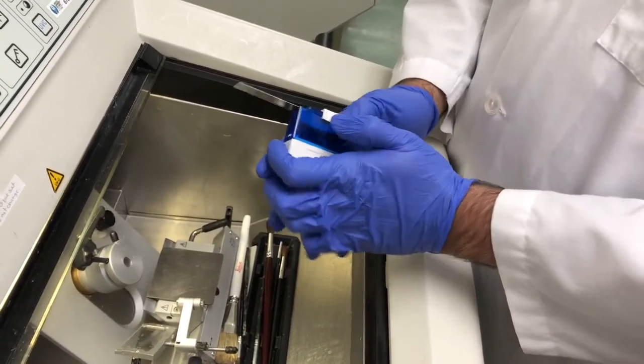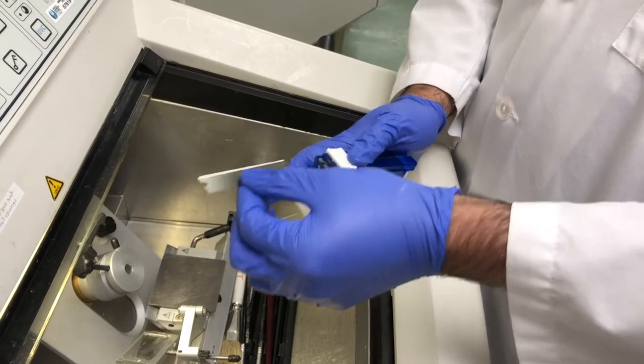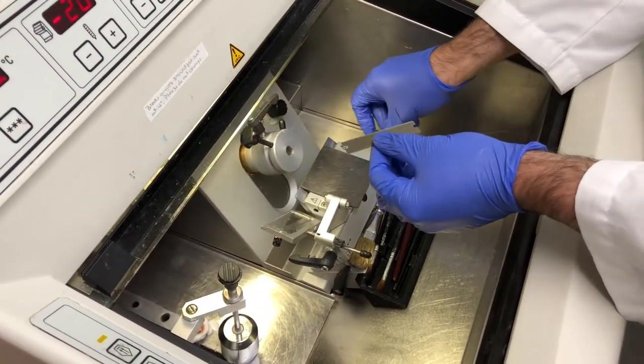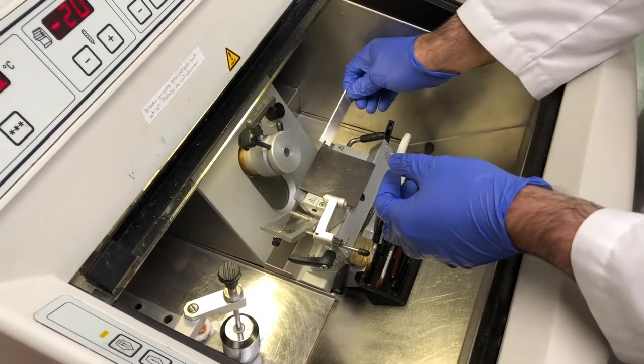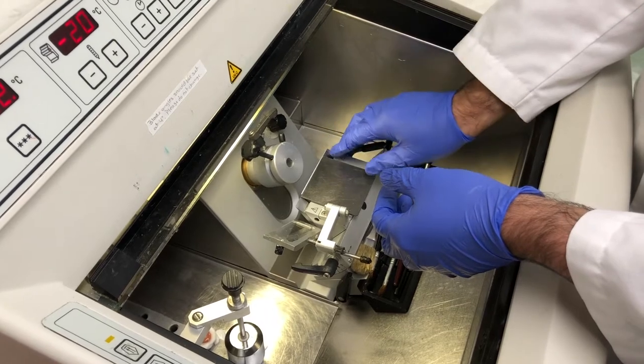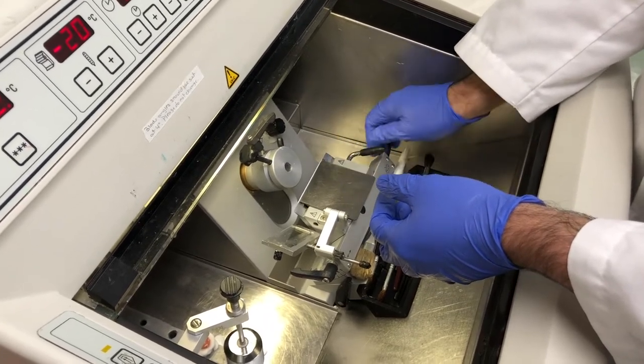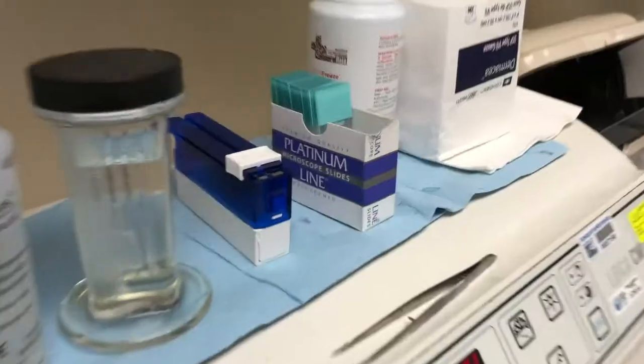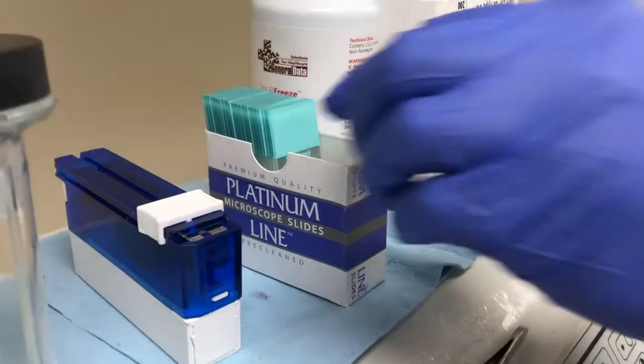Prepare the blade and get ready for the cutting. Take a few slides and label them.